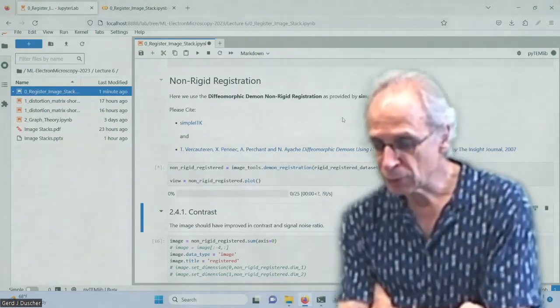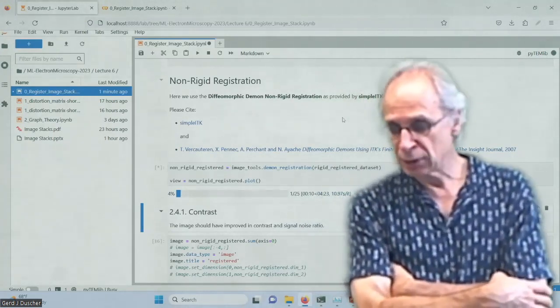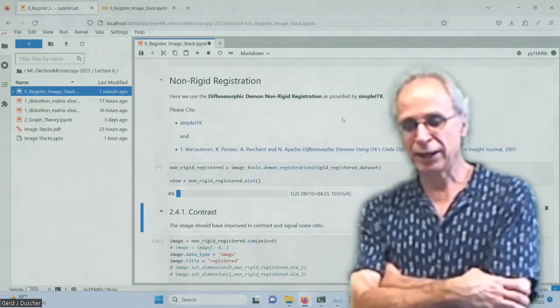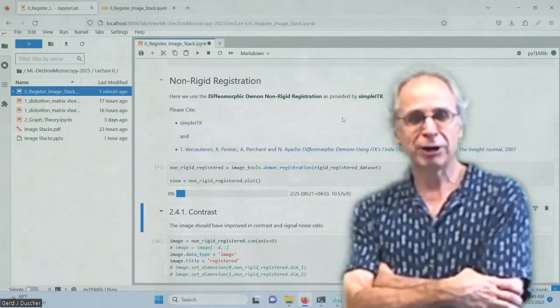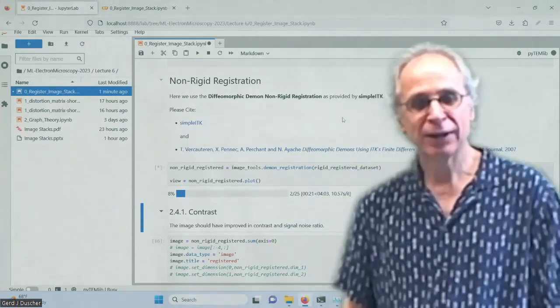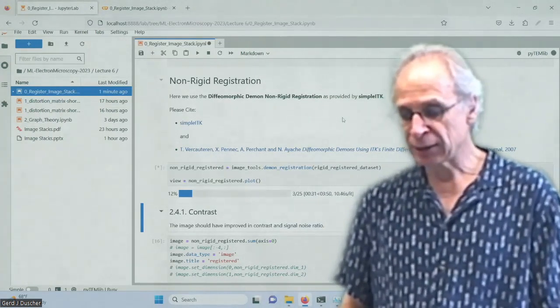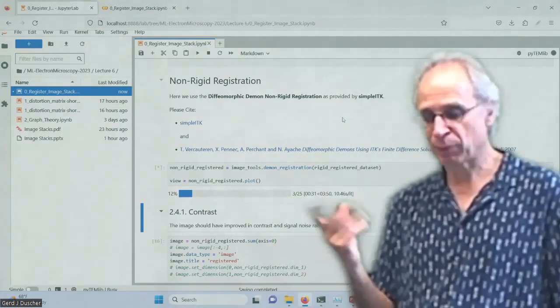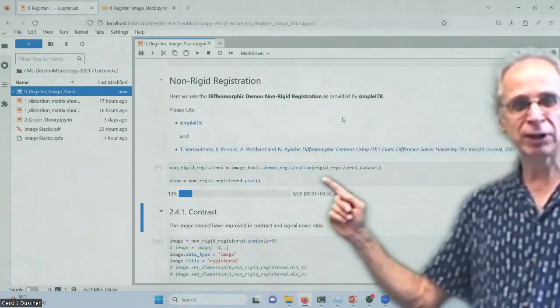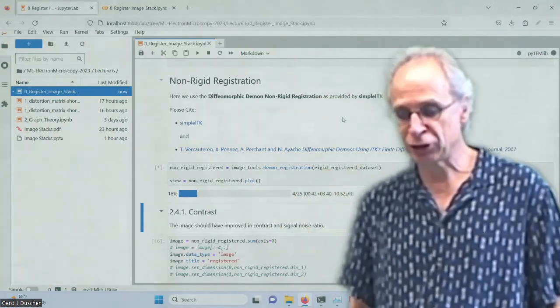On this, it's 5 minutes. So it's about as long as it is on Colab. If I don't have Zoom running, it's a minute. So you can run that on the supercomputer center, and then it's almost instantaneous. I'm using the simple ITK routines with demon registration.